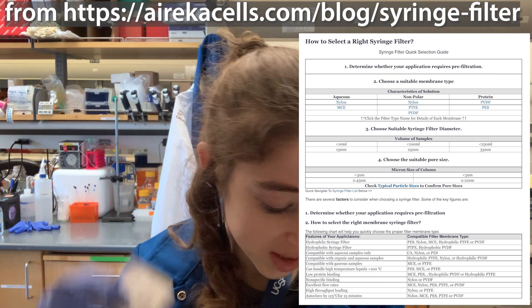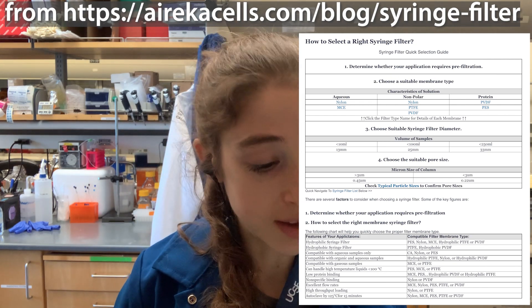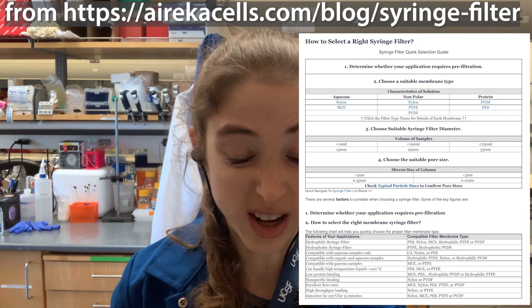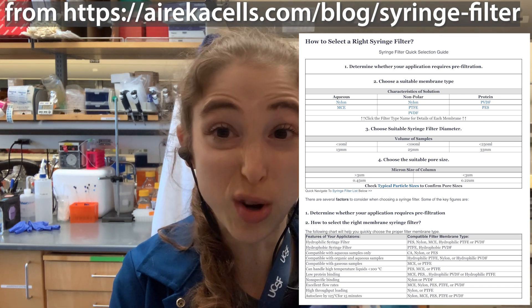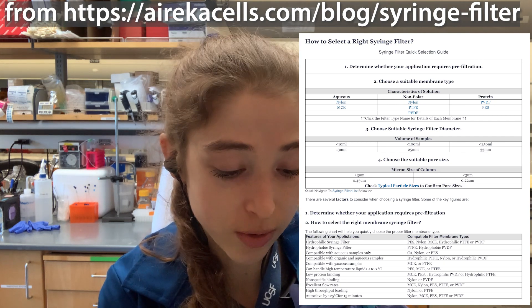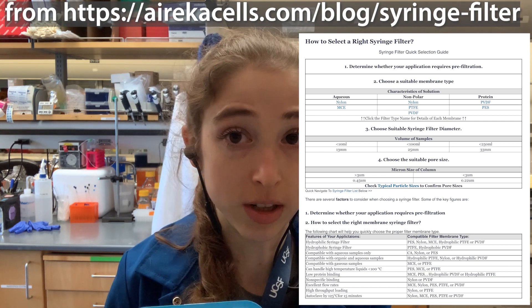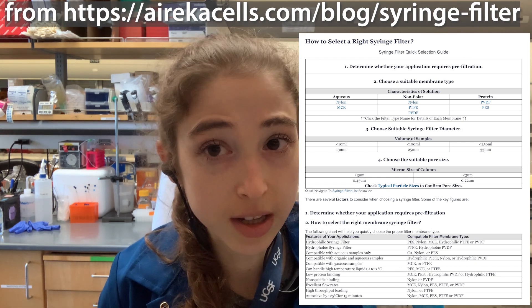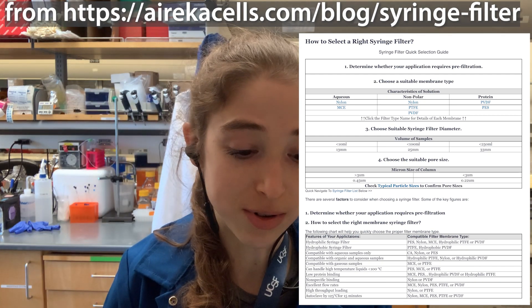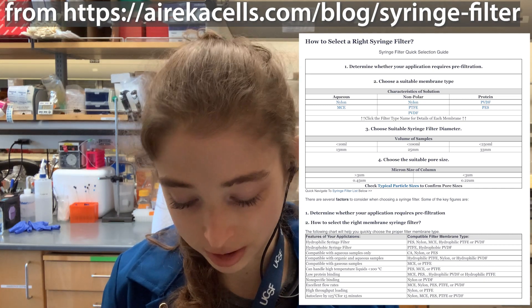Common membrane materials include PES, nylon, cellulose nitrate (nitrocellulose), and cellulose acetate. You don't want to use nitrocellulose if you're filtering a protein solution because proteins will bind to it. However, if you're trying to remove proteins from a solution — for example, when working to keep things RNase-free — nitrocellulose can be useful to pull out those RNA-degrading proteins.